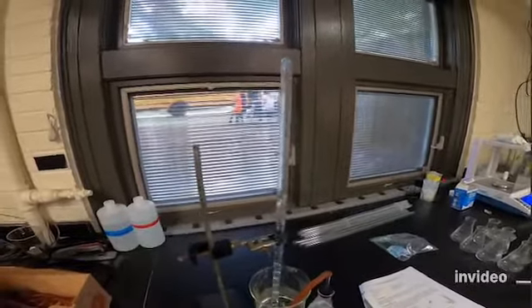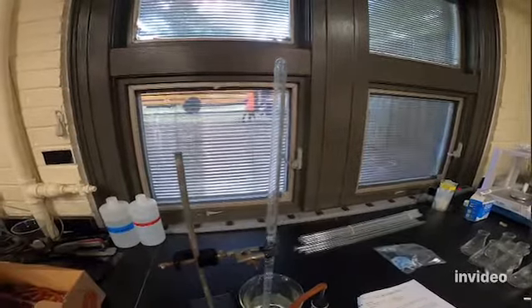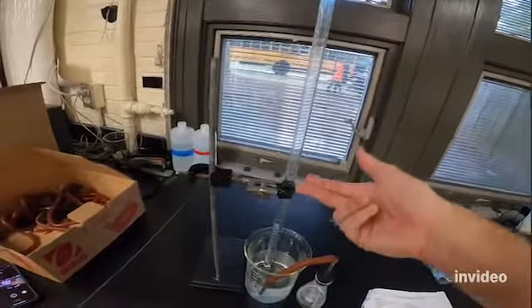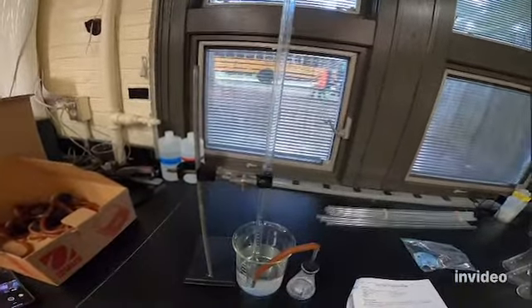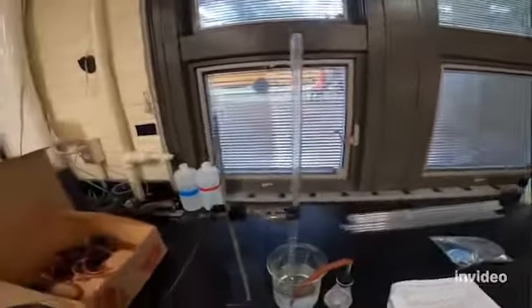And hopefully, since I just used 1/4 of an Alka-Seltzer tablet, hopefully it won't create too much gas, and I can still measure it. If we use too big of an Alka-Seltzer tablet, we can fill this eudiometer with so much gas that it goes beyond 50 milliliters, which is the highest value that the eudiometer measures to. So we don't want to use too big of a tablet.